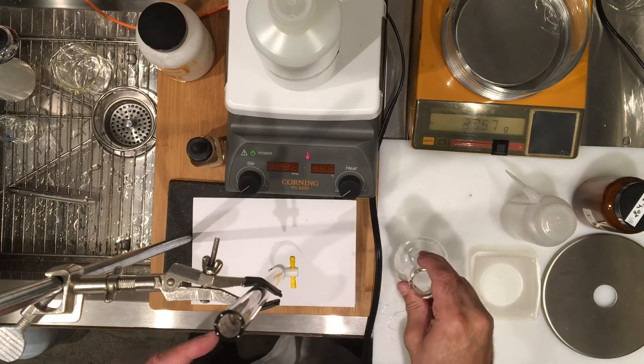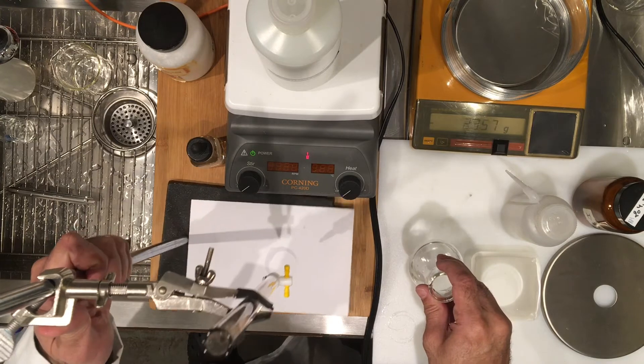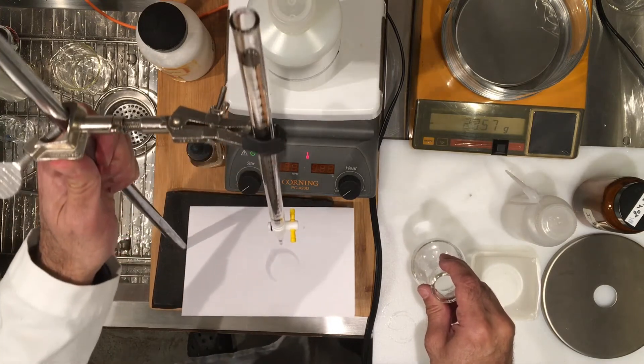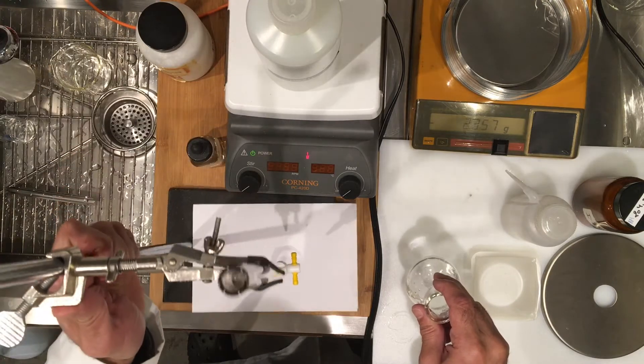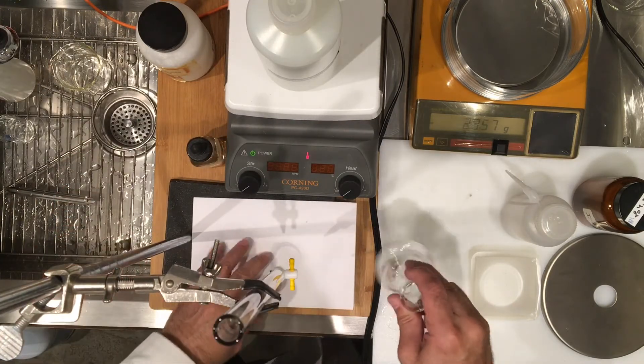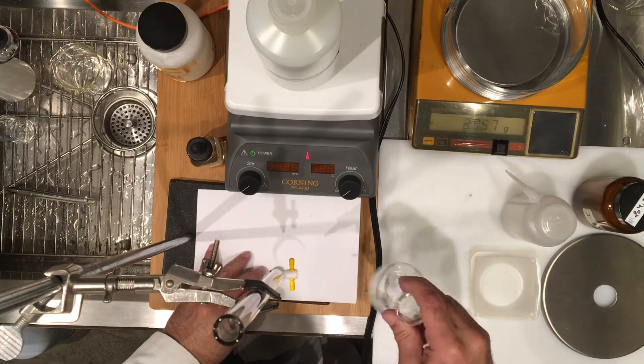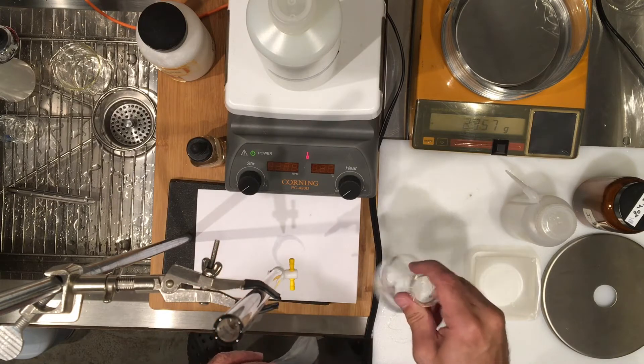This burette is rinsed with deionized water and I've filled it with the sodium hydroxide solution that I prepared before, and it has an approximate concentration of 0.1 molarity.